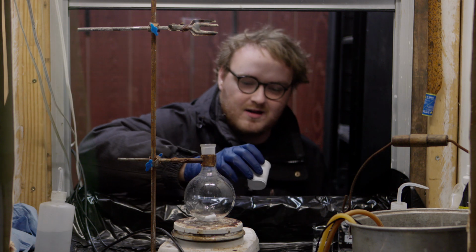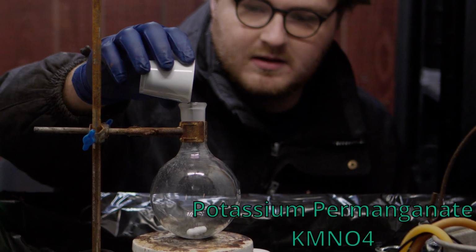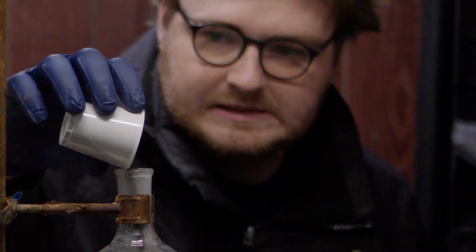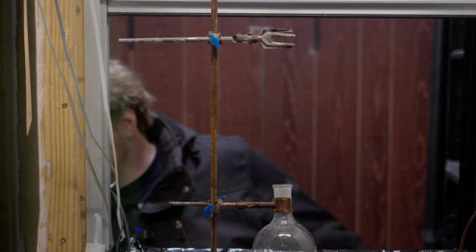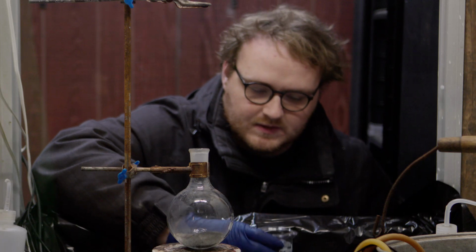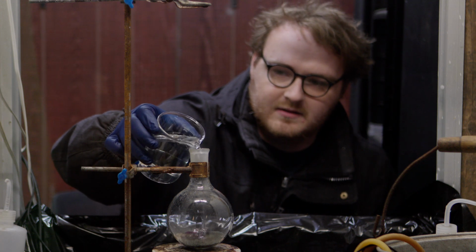So to start off, we're going to add 35 grams, and try not to dump all of it. Yeah, awesome. We'll take care of that. Next we add 250 mils of water with 2.5 grams of sodium hydroxide added.